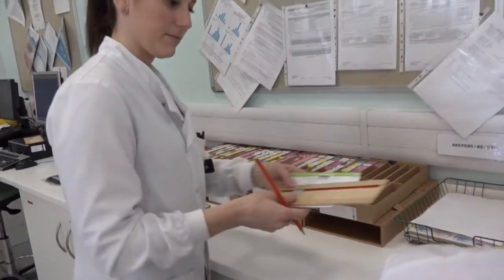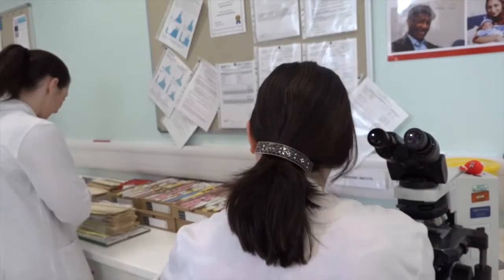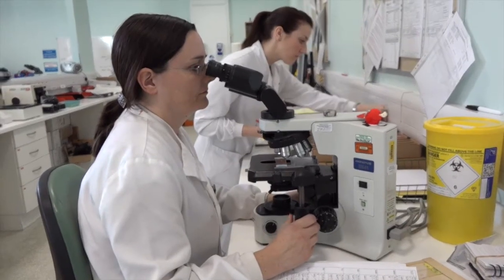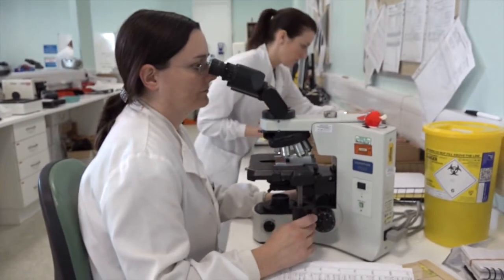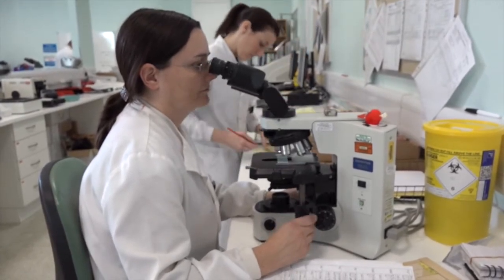The biomedical scientist is looking for a good quality section and to check that the staining has worked. Once we are happy with it, all the slides can go through to a consultant for them to diagnose and report. Once the case has been reported the result gets fed back to the patient.